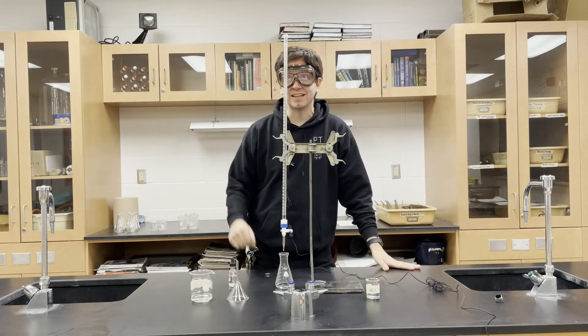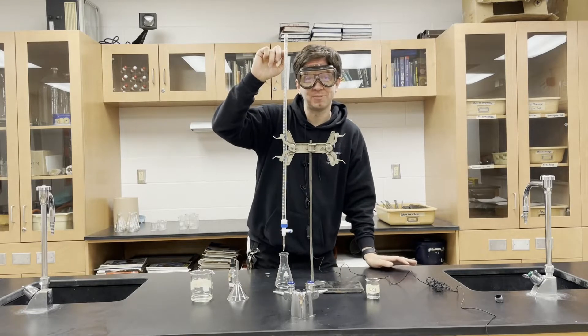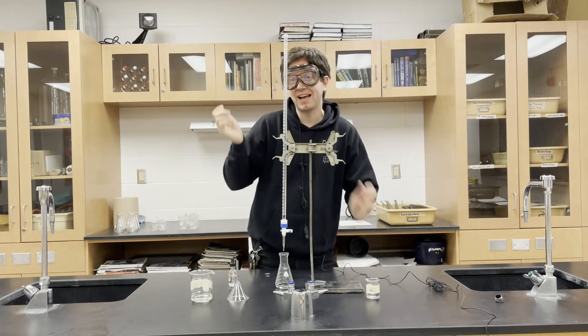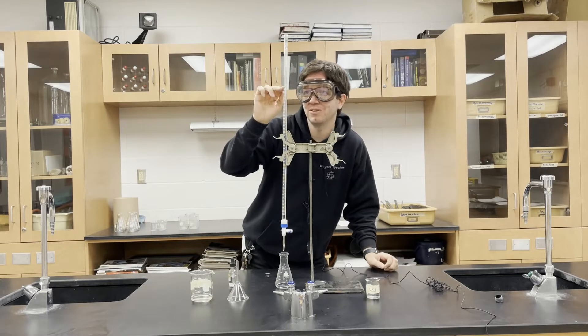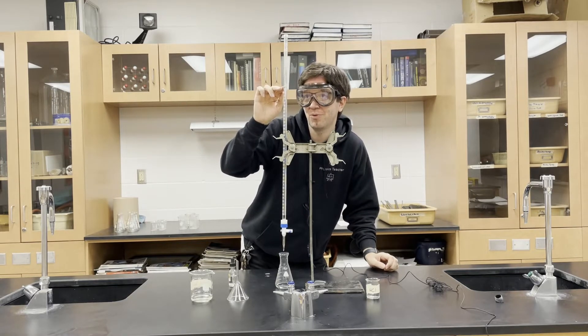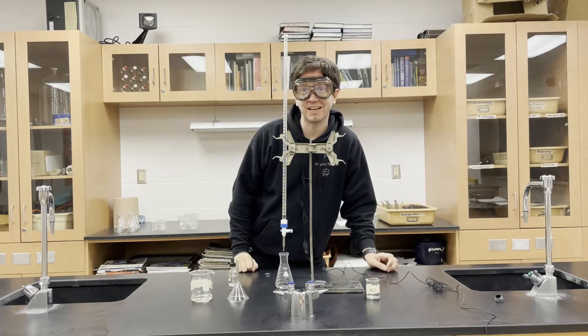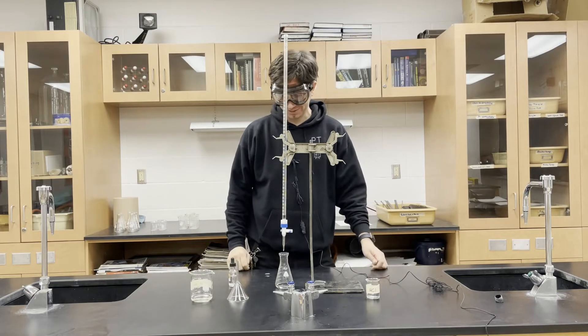Then you can take an initial reading. We've got zero milliliters up here. We're going to see how much we have to start before I release it. It looks like the initial reading will be 11.2 milliliters. So 11.2 milliliters is our initial reading.